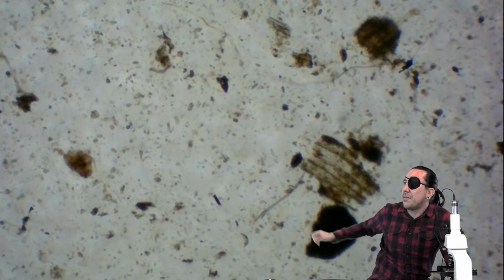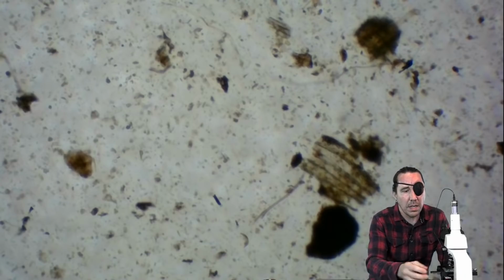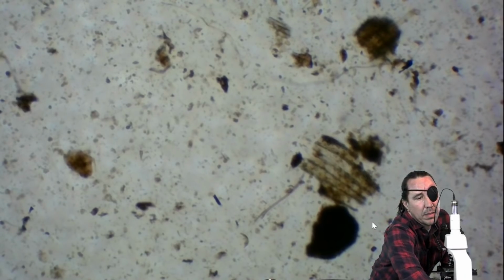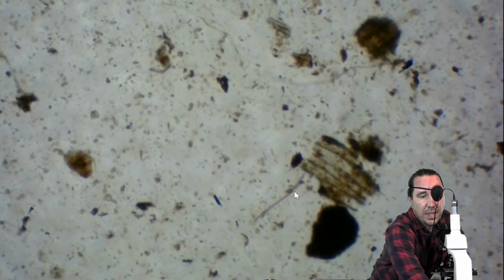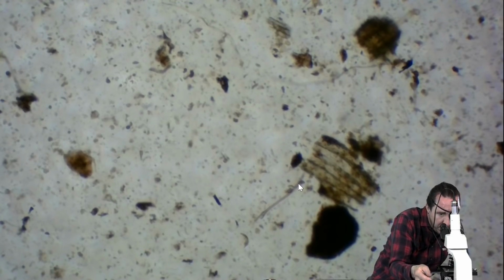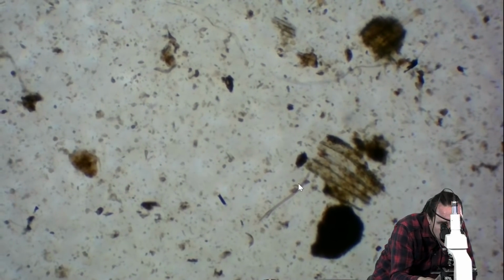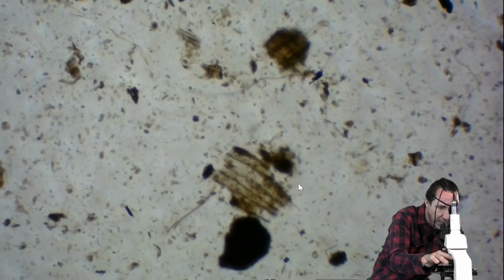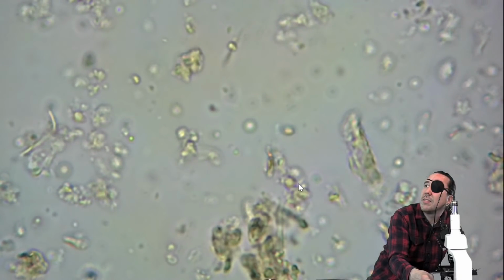So you're going to see some stuff like... Here we go. So this right here, you might wonder, is that a fungal hyphae? To me, just from having it this far out, it does not look like a fungal hyphae. But we can zoom in real quick and see if it is. I'm interrupting my nematode scan, but I thought this is what we had in mind when doing the microscope classes, just trying to find some stuff to view.